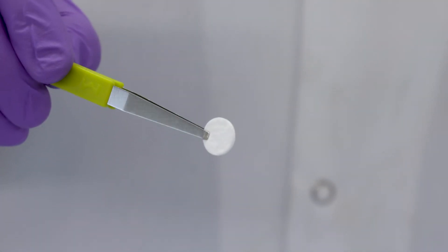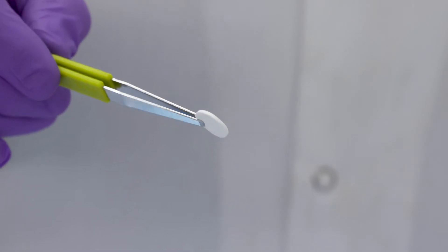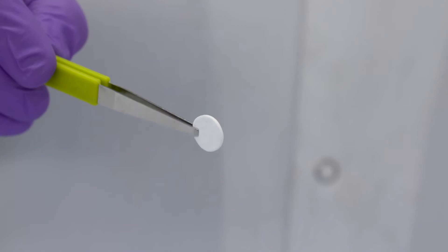Note, if a depth type pre-filter, 10mm, is used to extend the life of the filter, center the pre-filter on top of the final filter before adding the O-ring.